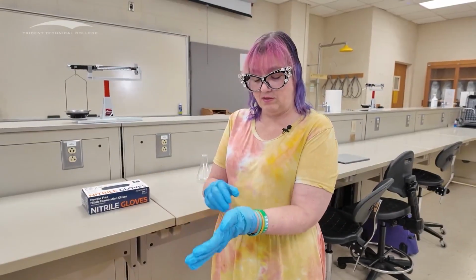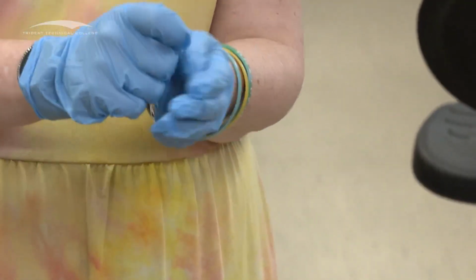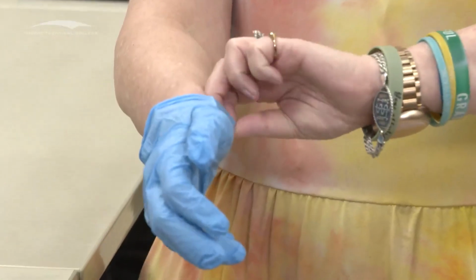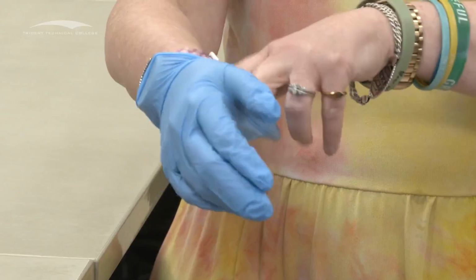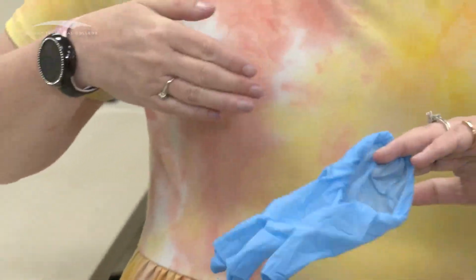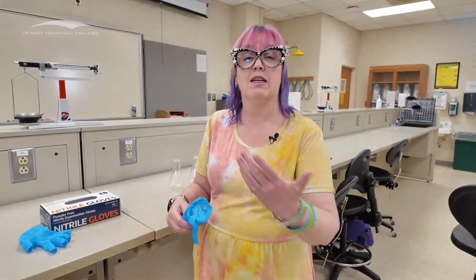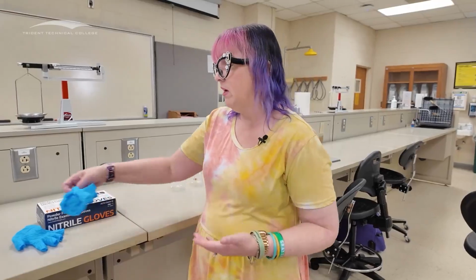If I'm going to take these gloves off, I can take the first one off fairly easily, right? Fairly simple. But when I go to take the second one off, I want to hook my fingers inside of it, grab a hold of the inside, and then pull it off like that so that I'm holding the inside when I'm dealing with it, not the contaminated outside part of the glove. And then I take those off. I'm then going to wash my hands to make sure that I get anything off of my hands that shouldn't be there, because sometimes we accidentally get chemicals inside, okay?